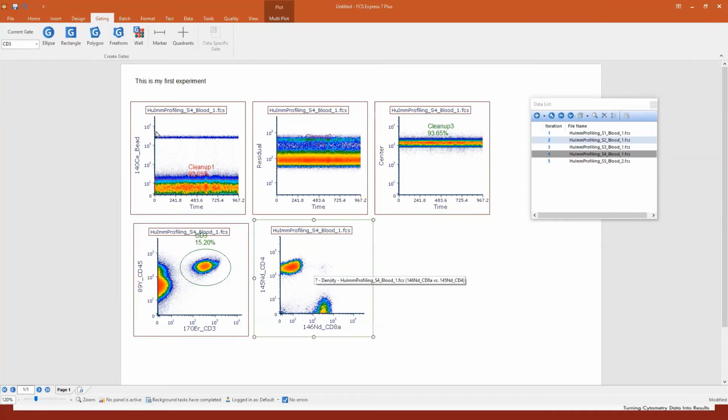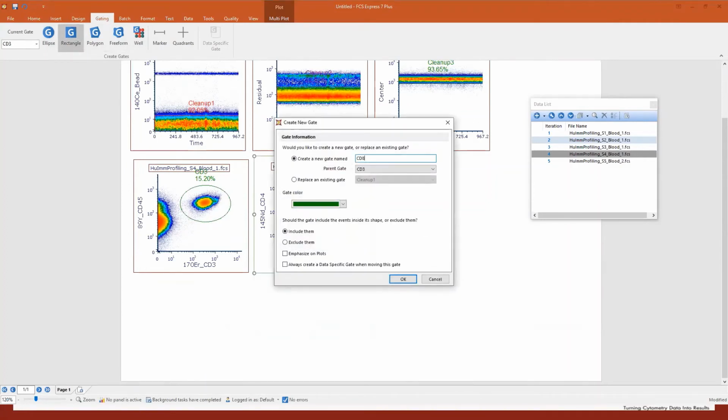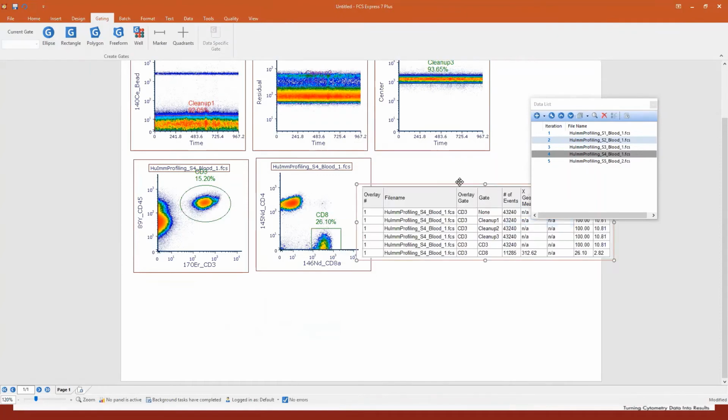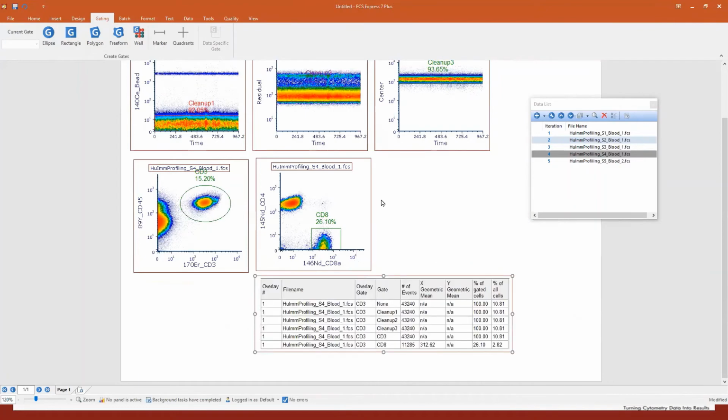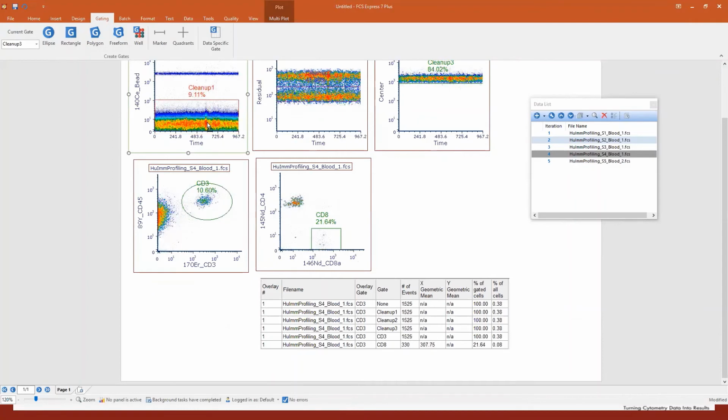Okay, of course you can retrieve statistics. Let's say that you have a gate here on CD8. One way to retrieve statistics from a plot is to right-click and select statistics, and you see now I have a nice table with all the statistics from this plot. And this table is of course live updating, so it doesn't matter which gate I'm changing, you see that the statistics update live. I can also move the parental gate, and still it's updating live.